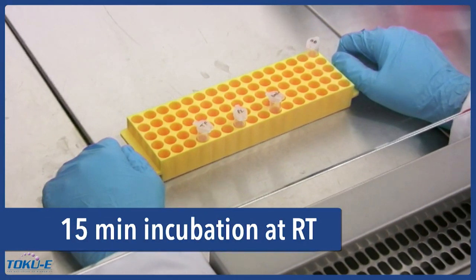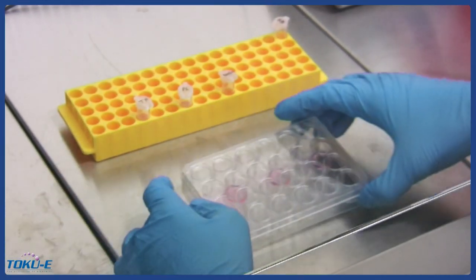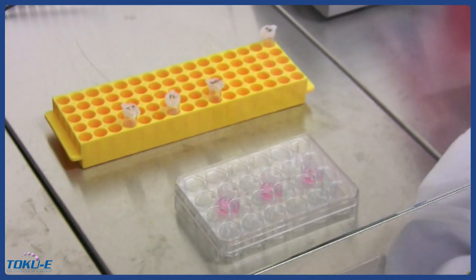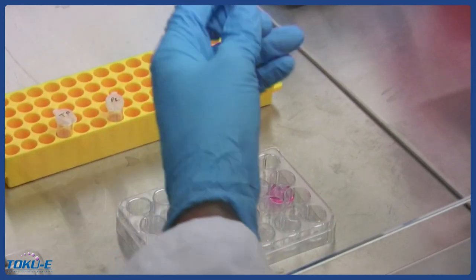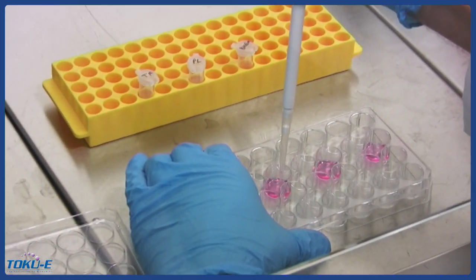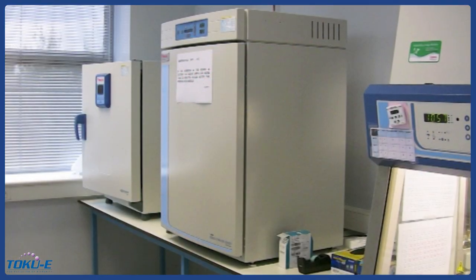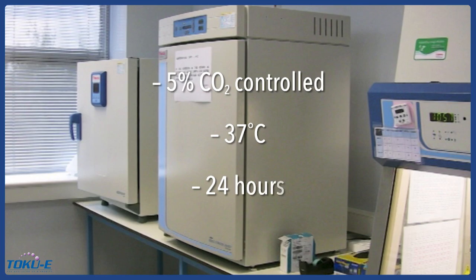Next, we incubate the mixture for 15 minutes at room temperature. After 15 minutes of incubation, we will add the mixture to the well containing the cells that will be transfected and place the 24-well plate in a 5% CO2-controlled incubator at 37 degrees Celsius for 24 hours.